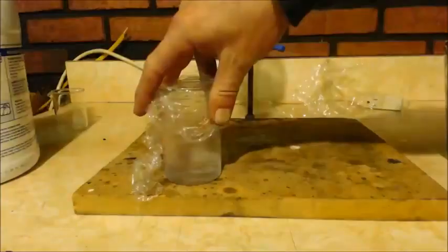I couldn't get that middle part to disperse, so I already drained that out. What was there? As you can see, there's nothing there now. And then I just spun it. You know what I mean? I got this and went like that. Kind of did a whirlpool thing and sucked it down. And you can see I got another like 2 milliliters or something there, maybe even 3 milliliters.